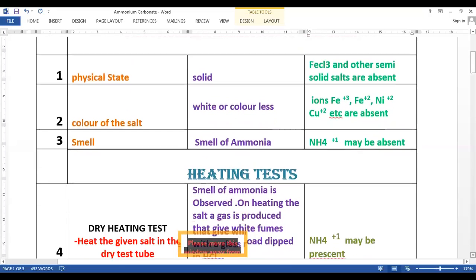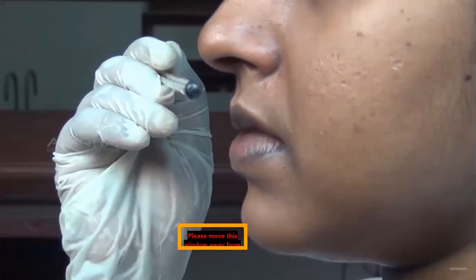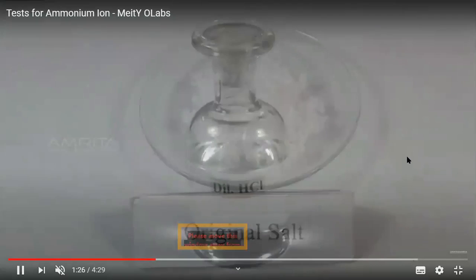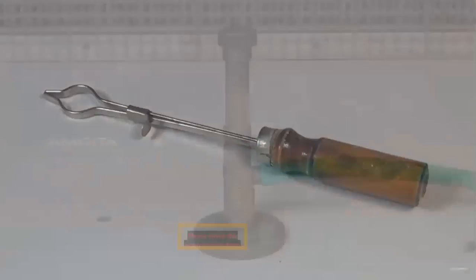Now, my dear students, we are going to perform the next test, which is known as the dry heating test. You can smell it, and you can easily understand that there we have the smell of ammonia. For the dry heating test, we need original salt, dilute hydrochloric acid, a glass rod, test tubes, a test tube holder, and a Bunsen burner. Let us perform the test.